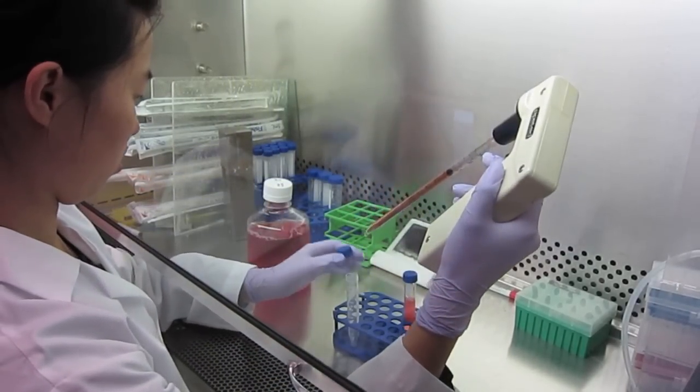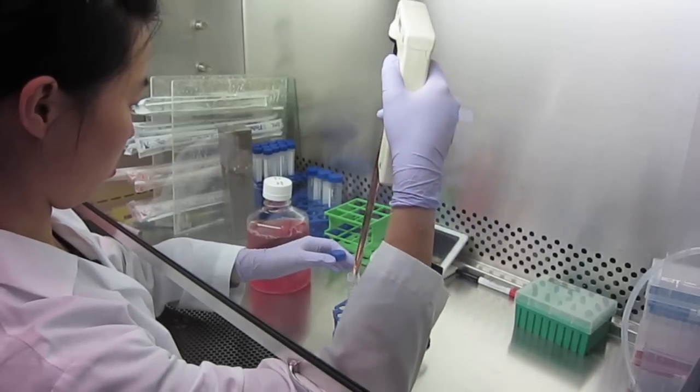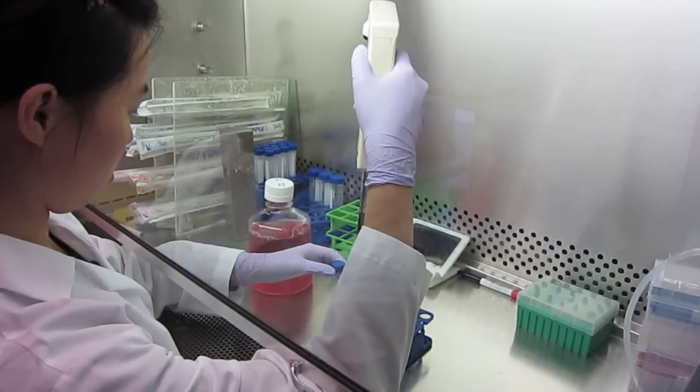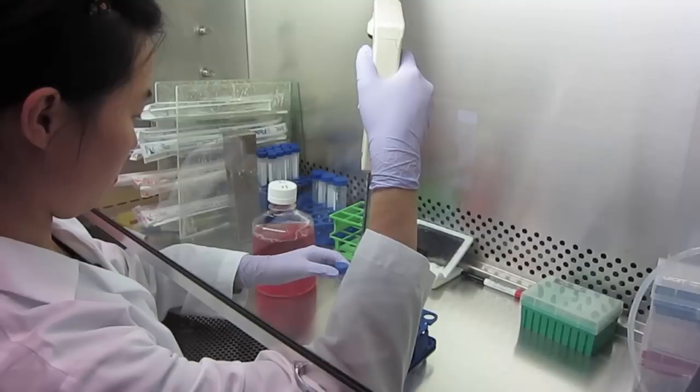When uncapping reagents, use one hand to hold the lid with the inside facing downwards. Do not leave any unused reagents uncapped.